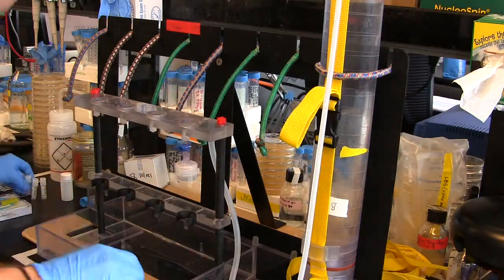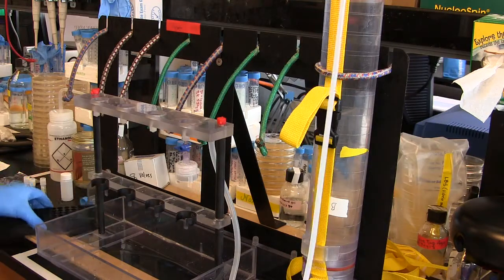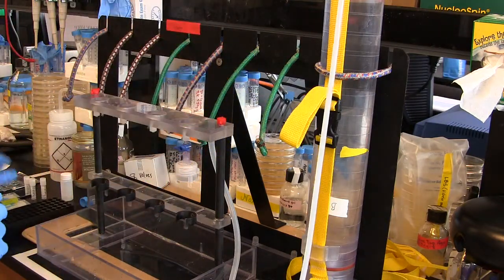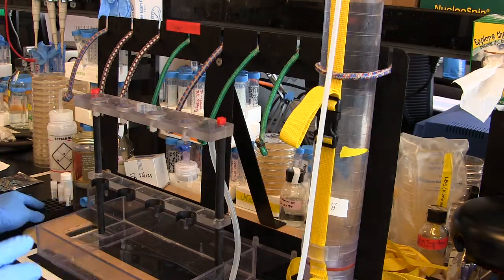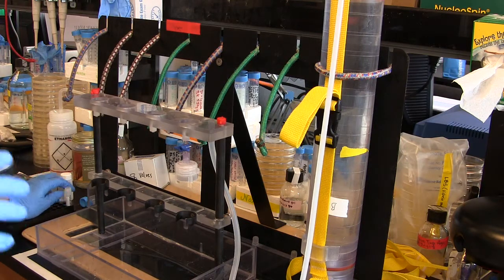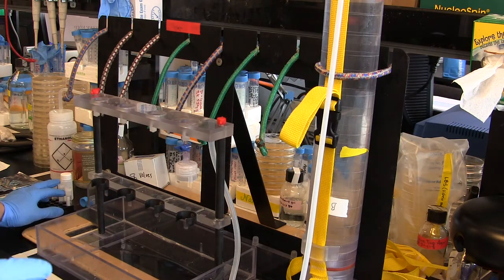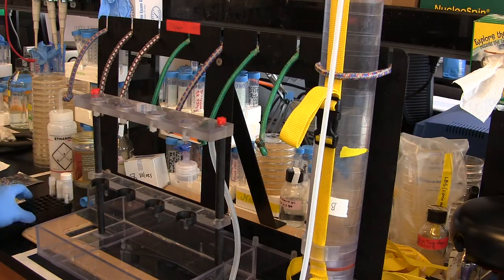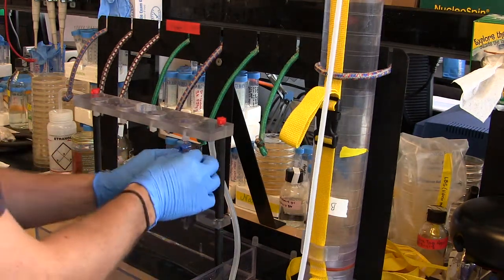On the ship I'd be keeping these in an epi tube holder. Put those there. Normally at this time I add the fixative, set my timer to 15 minutes, and then as soon as the 15-minute timer goes after I've added the fixative I drop these straight into liquid nitrogen. With flow cytometry, you want between 15 and 30 minutes fixation — do not go over 30 minutes, otherwise you'll lose their autofluorescence and won't be able to determine heterotrophs from phototrophs.